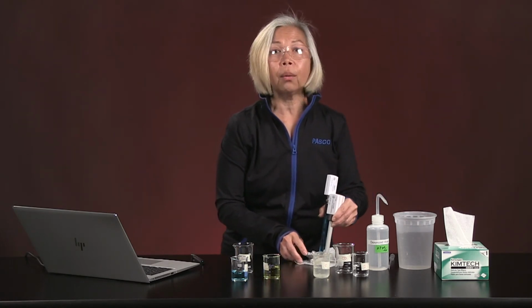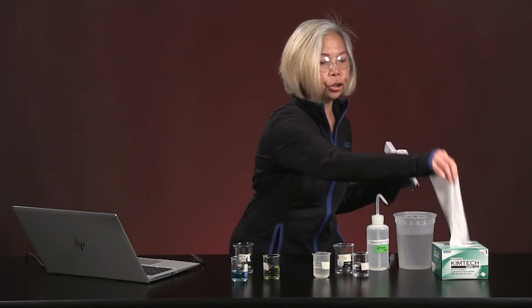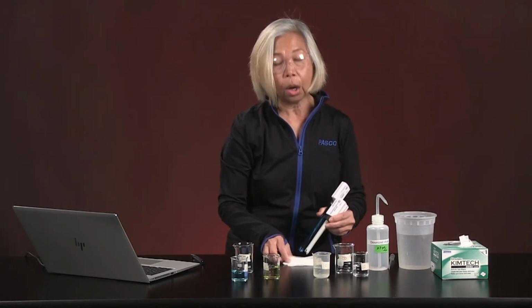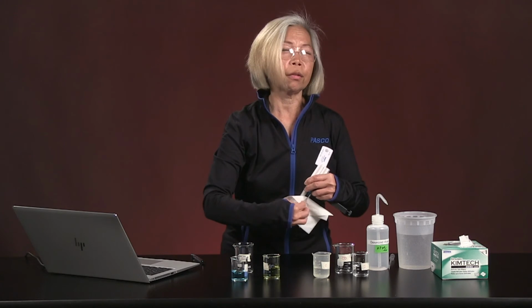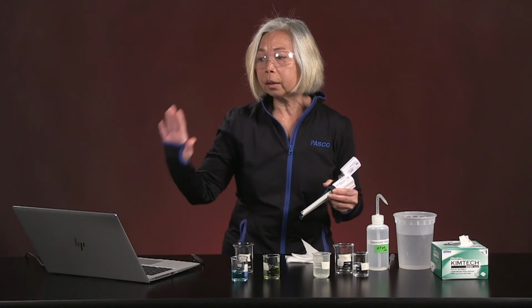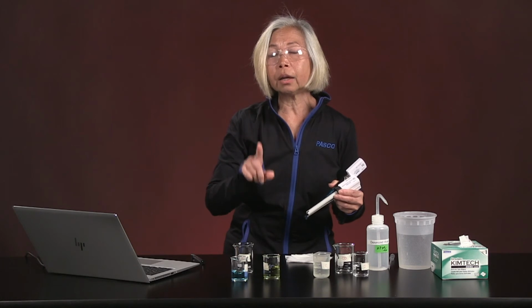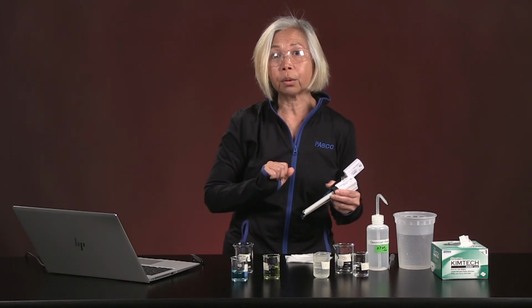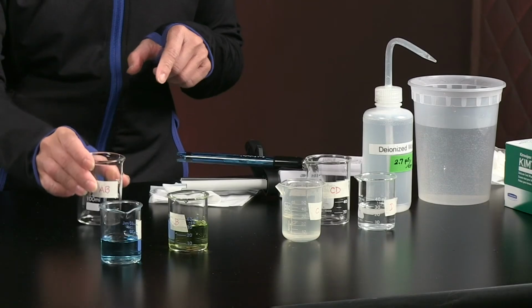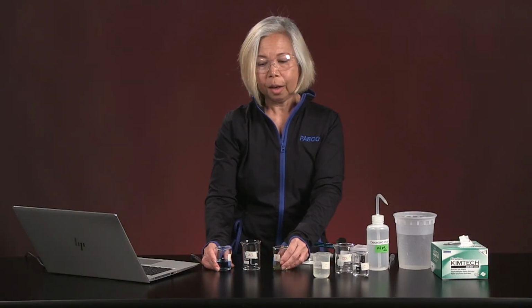All right, so now we have measurements of temperature, conductivity, and pH of each of our solutions. Let's see what happens when we mix them. Are we going to have a physical change? Or are we going to have a chemical change? So I want you to make sure that not only are you watching our SparkView screen, that you're also looking at the data you have already collected on each of our solutions. So let's get started. I have a beaker in which I will mix solution A and solution B.